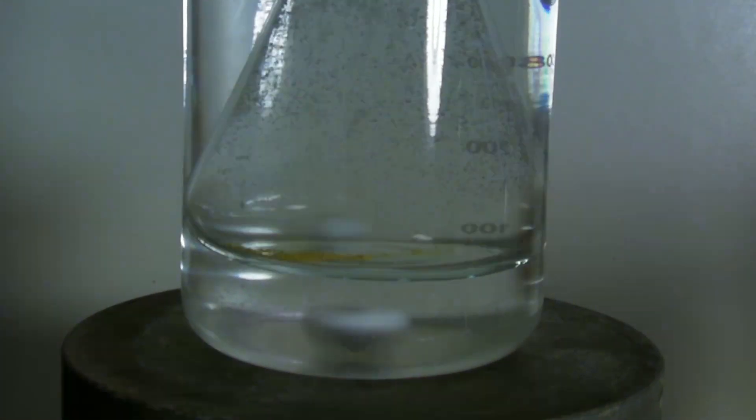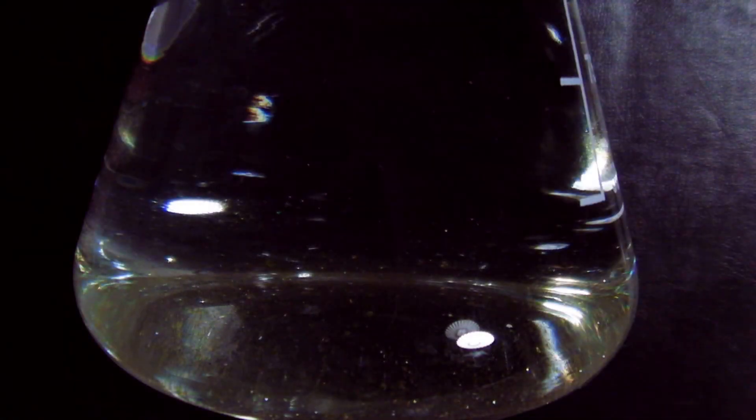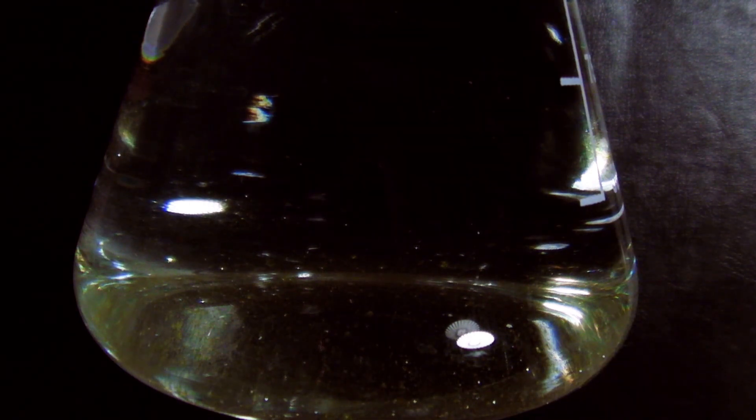At the end, a clear colorless solution is obtained even though lead iodide is yellow. After half an hour, first crystals begin to form.